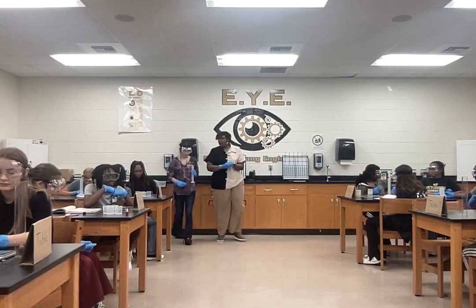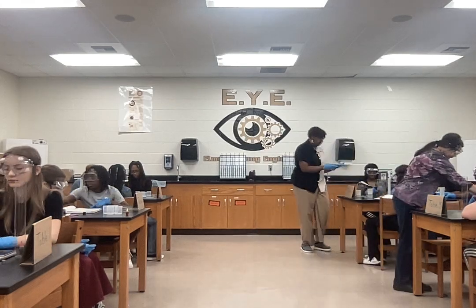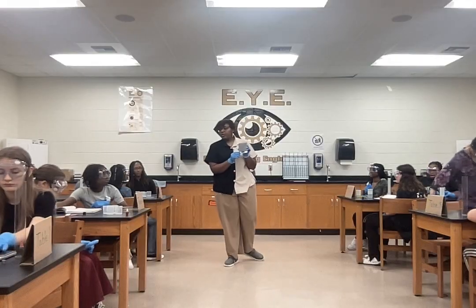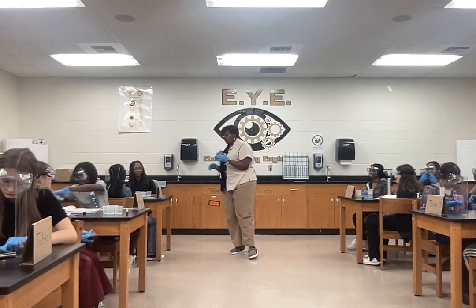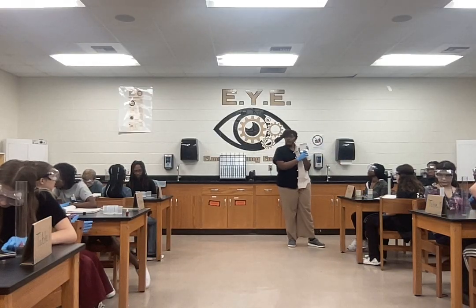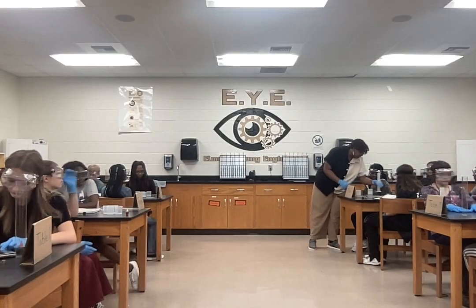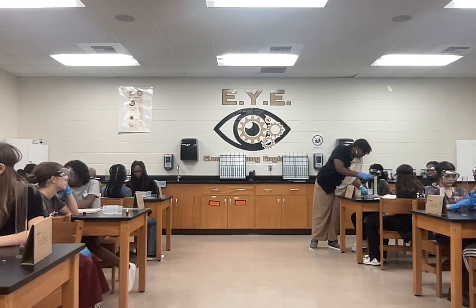All right, so now what I want you to do is take the graduated cylinder. Can I use this group to demonstrate? So if you turn on your balance, you're going to press the power button, and you need to wait for it to display 0.0, okay? What you're going to do is zero it out and make sure it's in grams. There should be a small g in the top corner, and you guys can do this as I'm doing it. You're going to take your graduated cylinder with water and set it on top of it.